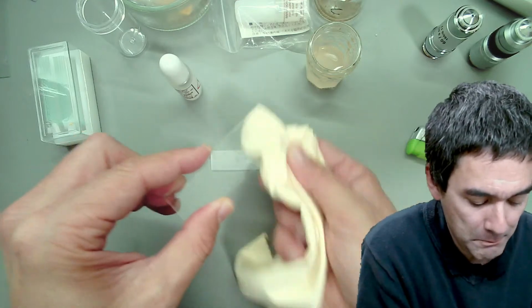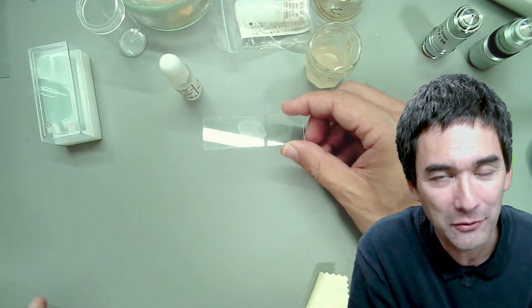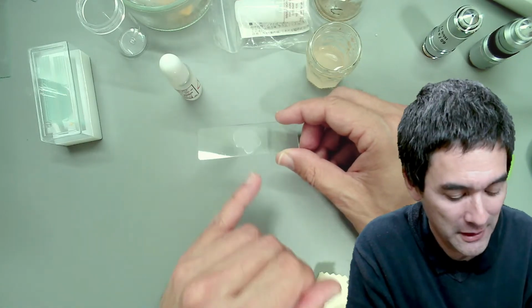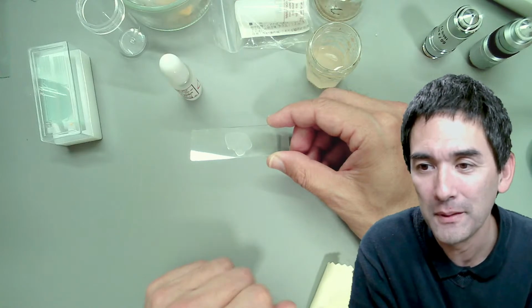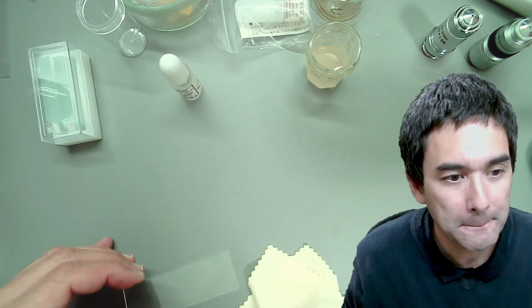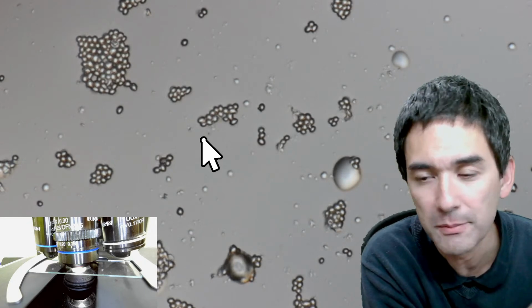The cells should now be baked to the glass, and I do actually see a difference. It's a little bit like when you put an egg on a frying pan, it turns white because of the proteins that denature, and something similar happened here as well. I don't know if you're able to see it, but the spot is a little bit whiter. Okay, so then I'm going to put it back into the microscope, and we see that the cells are still here as before.